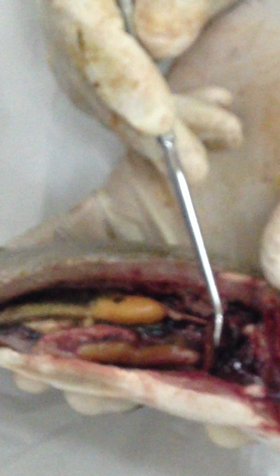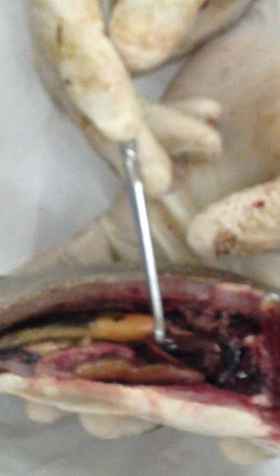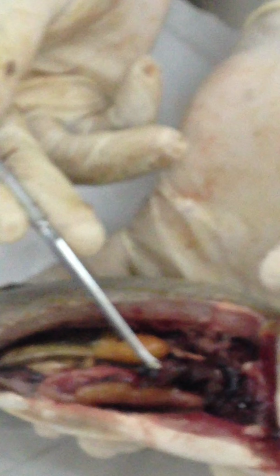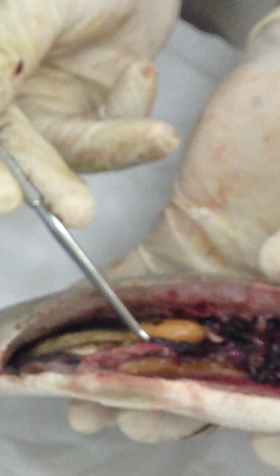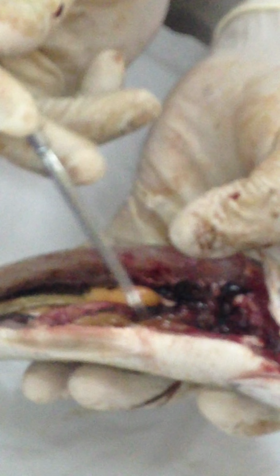Then, as we come more caudally, we see the liver. But usually the liver also has pancreas mixed up with it, so we call it hepatopancreas. In certain fish, we're also going to find the gallbladder, but not all of them have one. Yours is pretty distinct. The gallbladder usually shows as a big sac with clear fluid, which has a slightly bluish tinge.